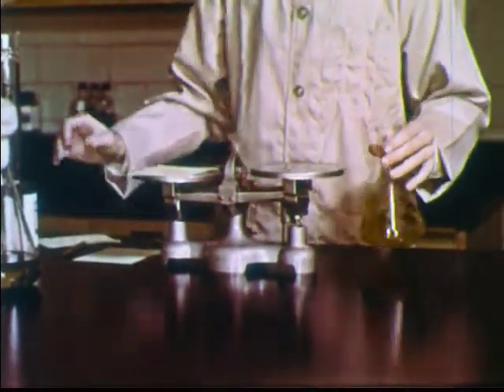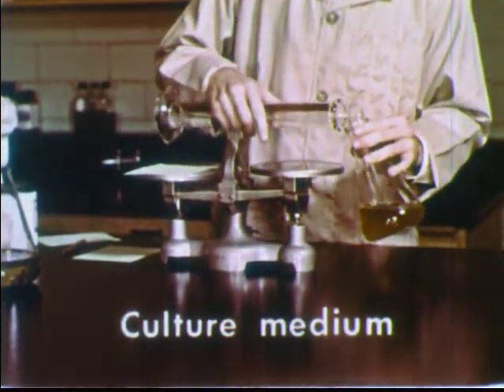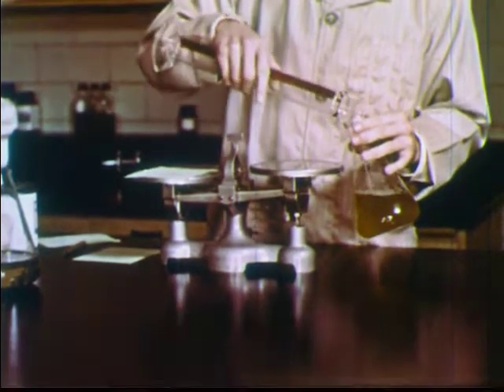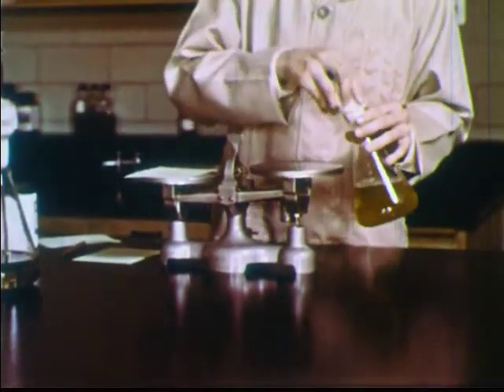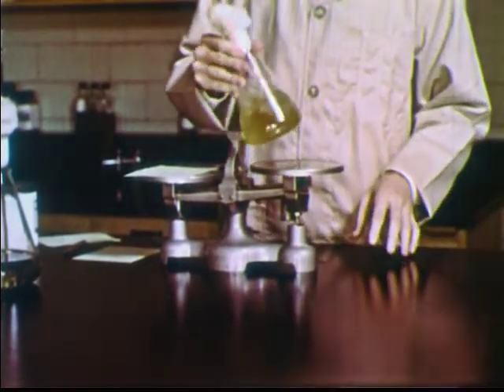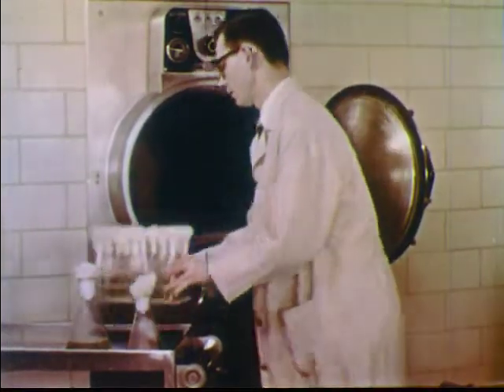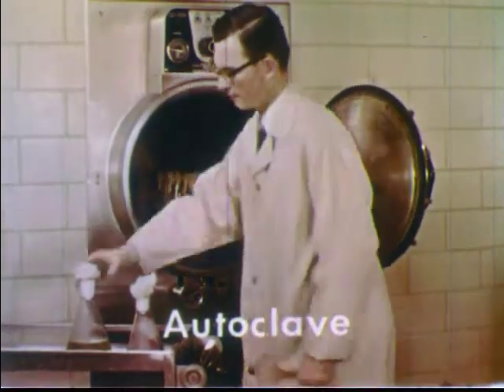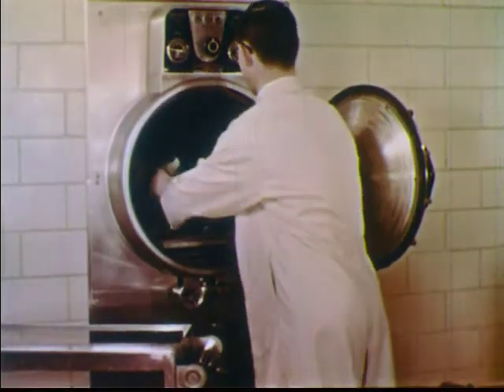Such a nutrient solution is called a culture medium. To keep out unwanted organisms, containers are covered with metal caps or are plugged with cotton. Then, before use, all nutrient materials are sterilized in an autoclave, which uses compressed steam in a manner similar to a pressure cooker.